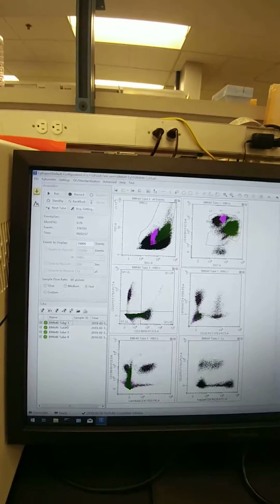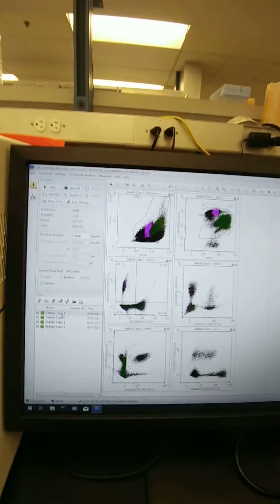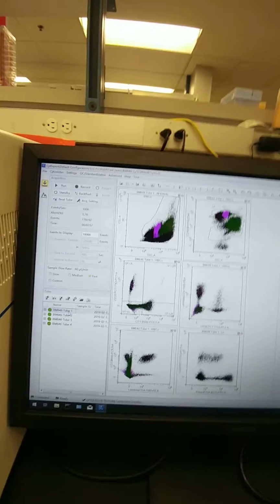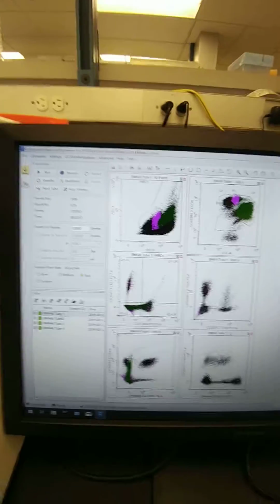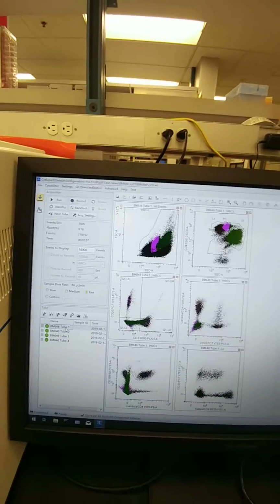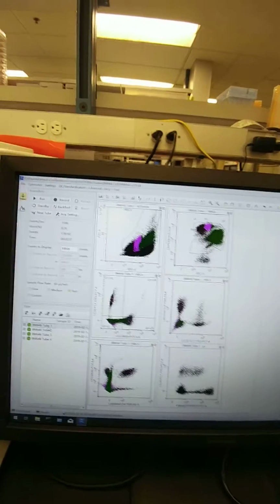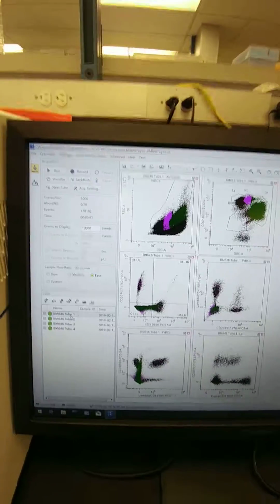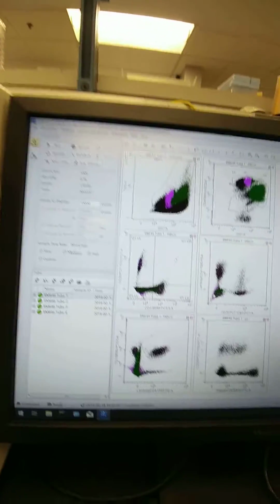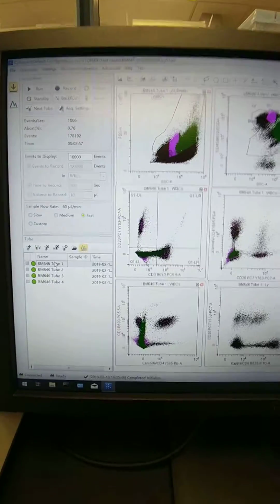I know I've sent y'all one or two videos about acquisition gains using individual antibodies, and also how you might be able to do it just using leftover sample from a patient to adjust. So here again we're going to go through step by step, running a sample, realizing gains need to be adjusted, and how you can use the leftover sample to work with changing those and getting them where we really want to see them. Okay, so I've already set up and run a bone marrow sample, as we see here.